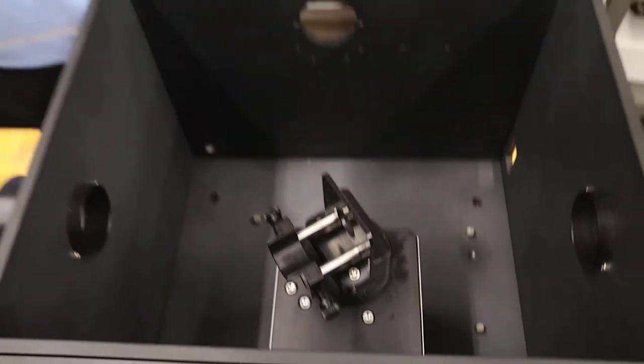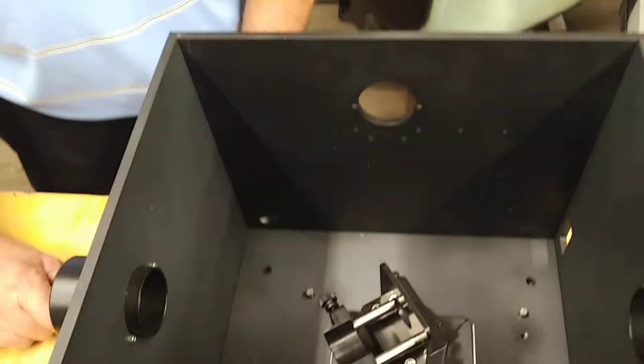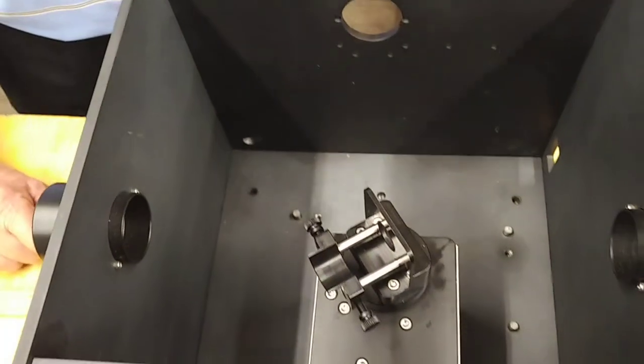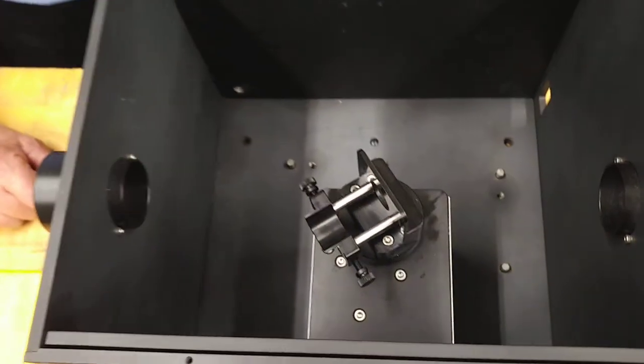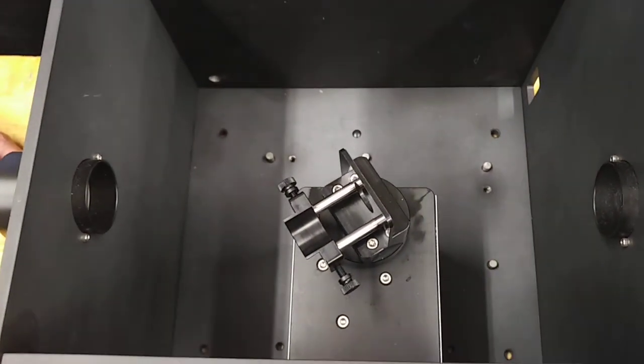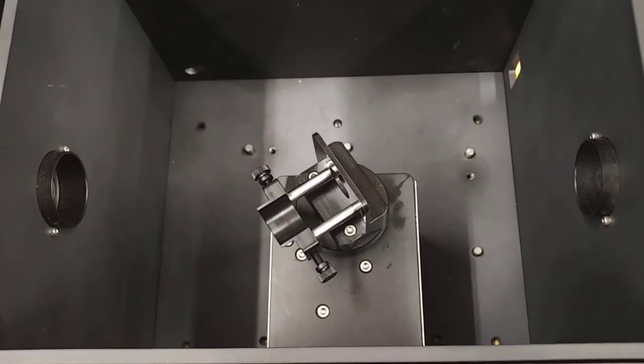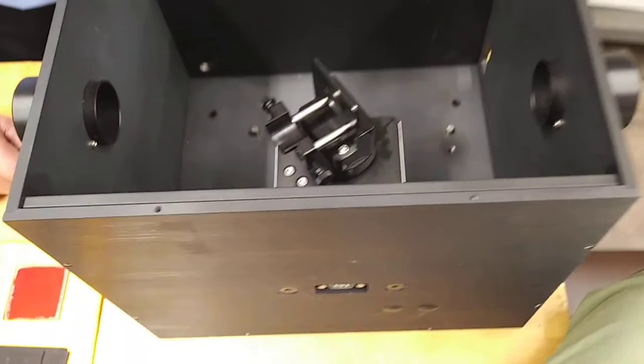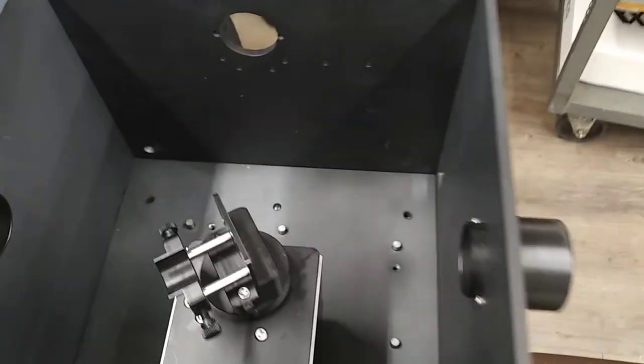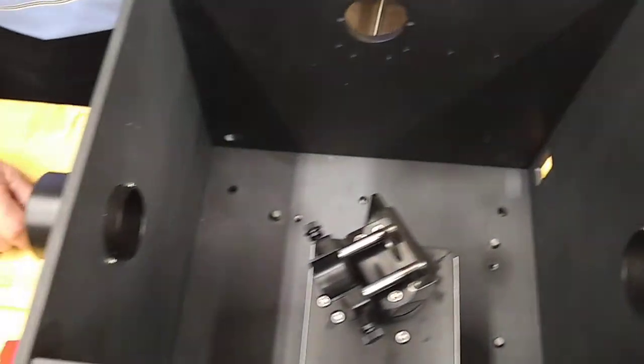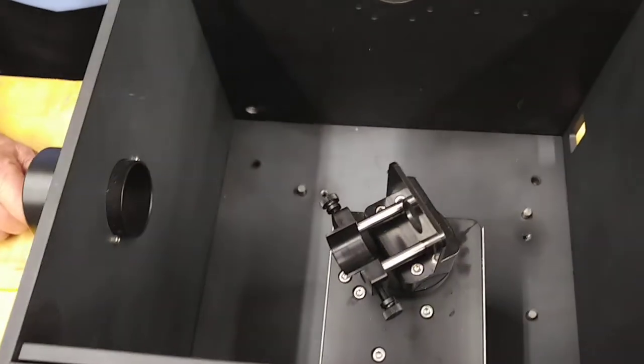Hi, I'm here with our chief engineer Rich Hantis who's going to work with me today on installing up to eight different samples in our variable angle thin film holder. We're using a mock-up of the polarization toolbox for this demonstration.